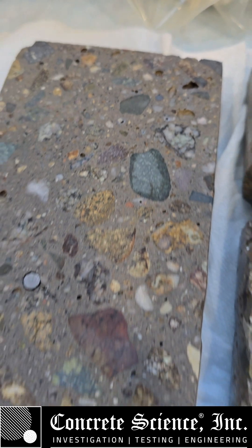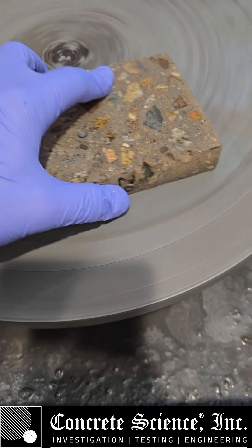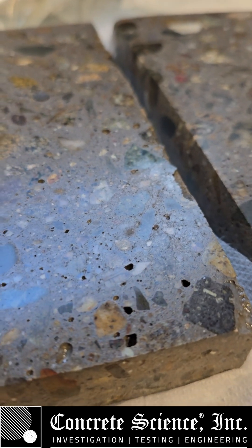One more. One thousand. And there you go. 1000 grit. Polish. Just a slight — look at that shine.